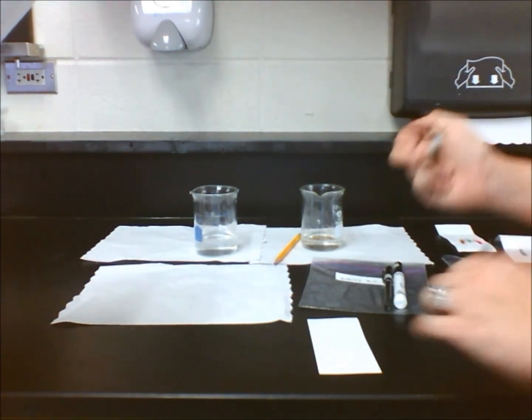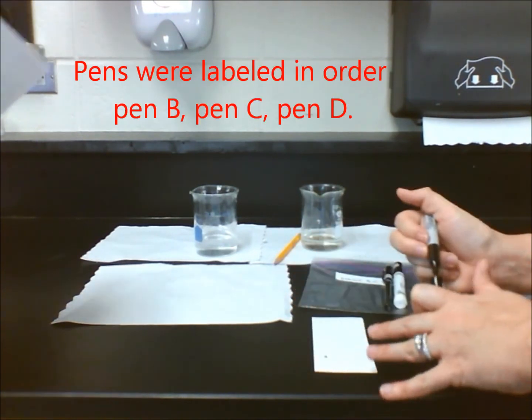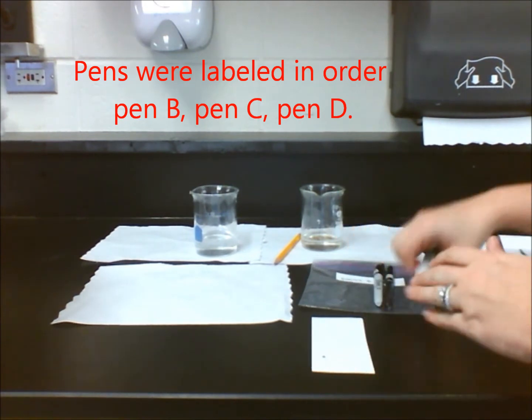Using the chromatography paper, we can analyze each of the black pens more carefully. Make sure that you write a detailed procedure before conducting the experiment.